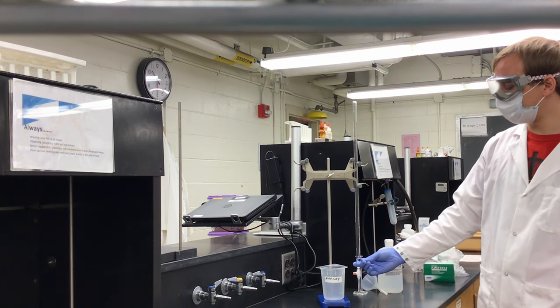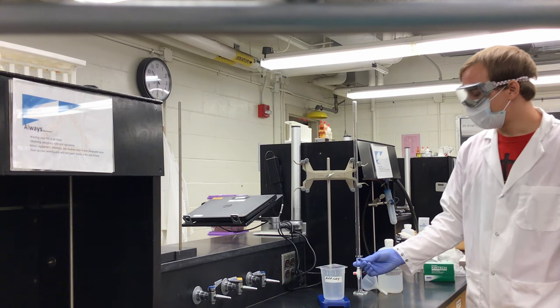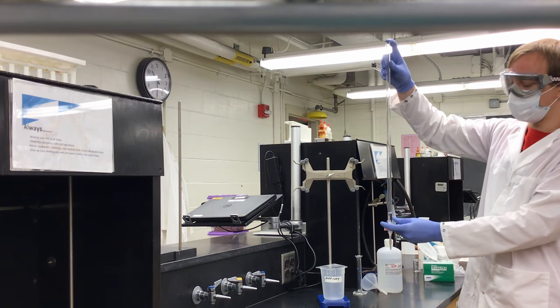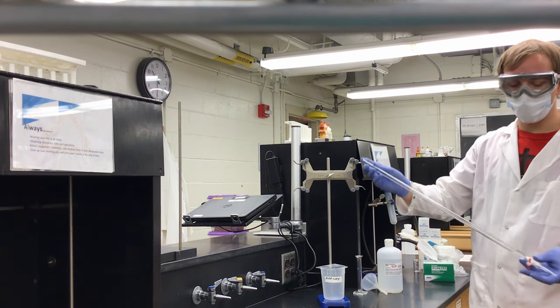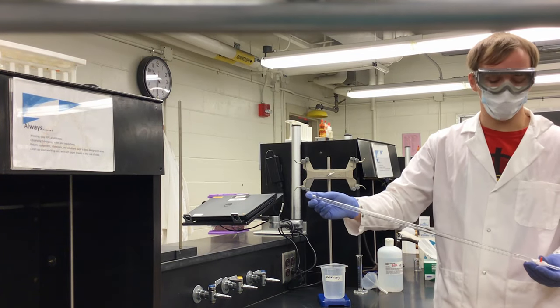It is sitting a little below the 50 mL mark at the very bottom of the burette. When rinsing your burette you should aim to pre-measure three milliliters or eyeball your titrant to about this level. If you use any more than that you will end up wasting a significant portion of your titrant and you will run out in lab.